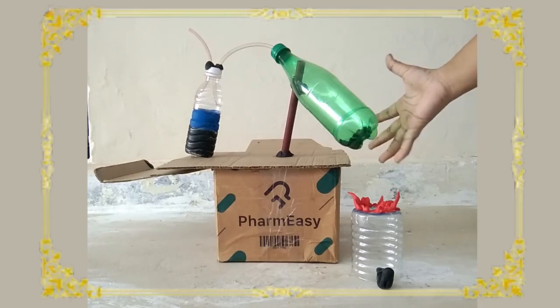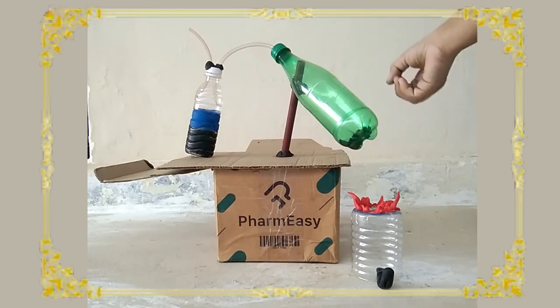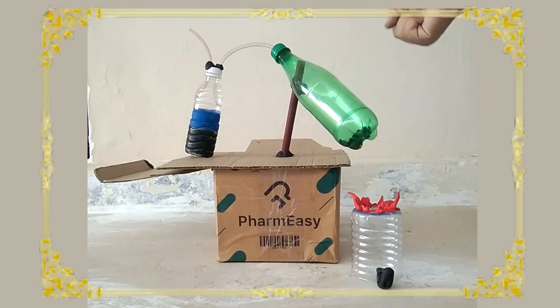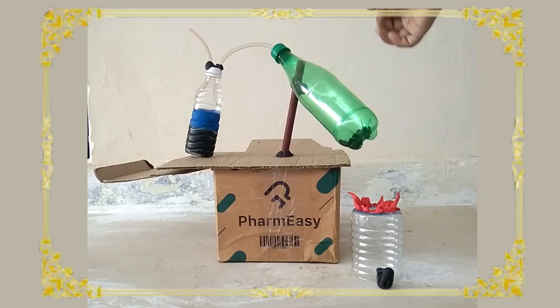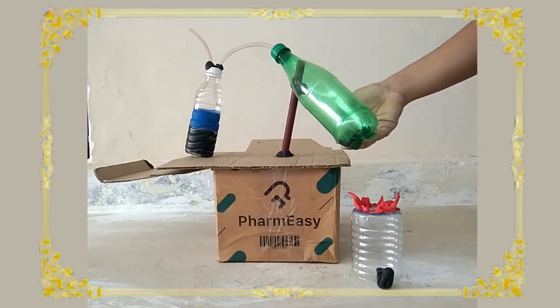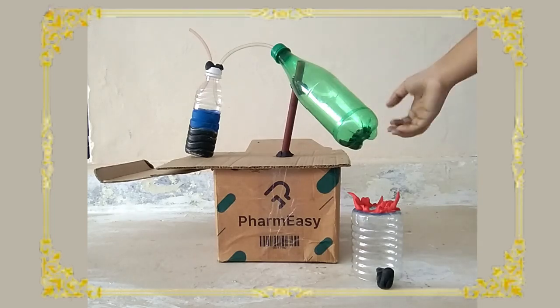Coal gets heated and all the things happen. Now, the remainder of coal is known as coke. This is a reducing agent and it is used in a lot more things. This is the almost pure form of carbon, as all the scientists say. The coke is the almost pure form of carbon.